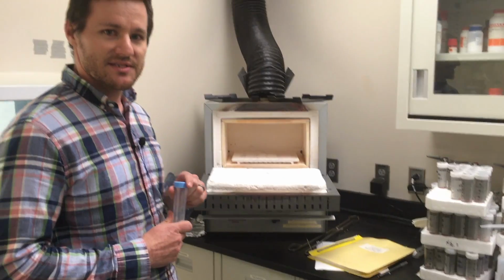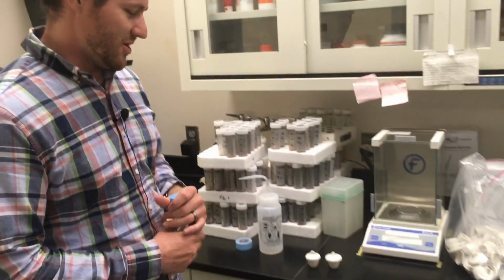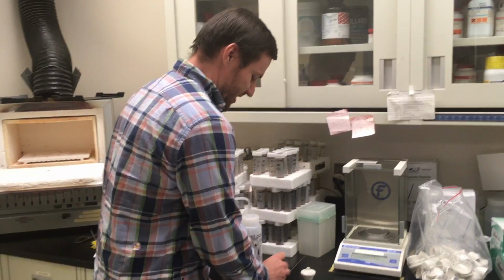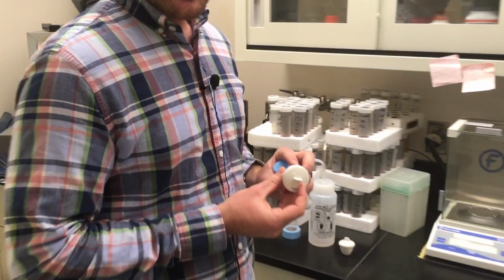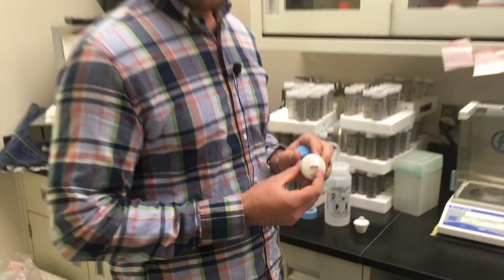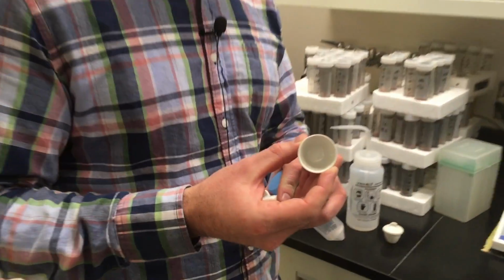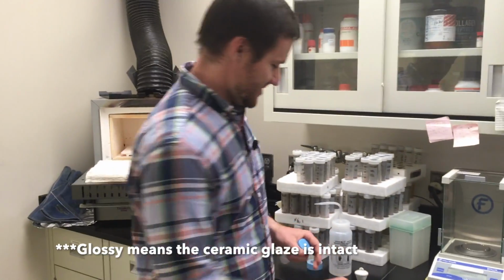And so when we put things inside the asher, we like to use what we call crucibles. These are our crucibles. There is a basic strategy you'll want to apply when you are using crucibles. For instance, it's really nice when you can find a crucible that's really glossy. You can see the lid of this crucible is very glossy. There's probably not a whole lot of things that are going to stick to it. If you actually open it up, you'll see that it's also glossy inside. It's nice and pretty. That's a good one to use.